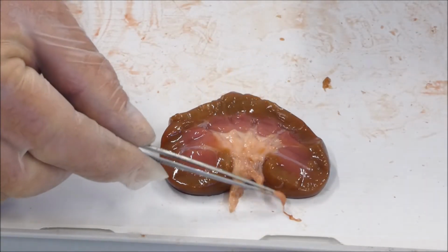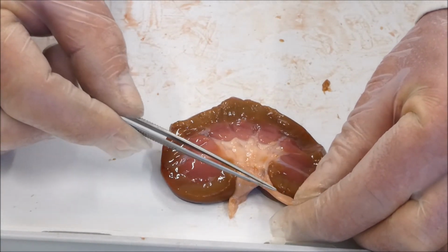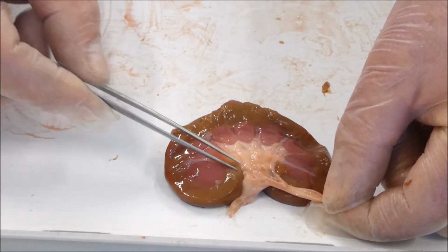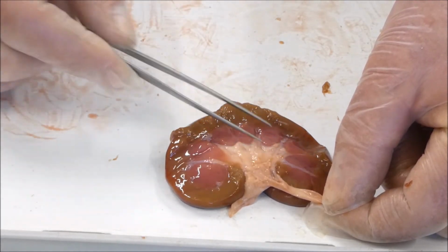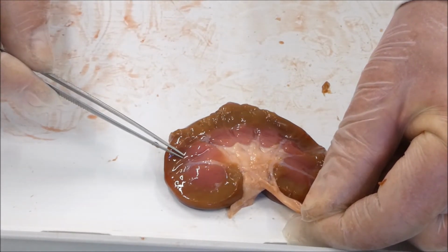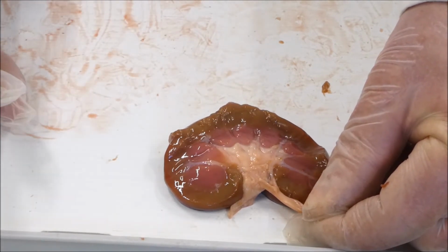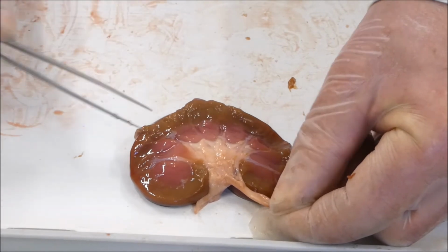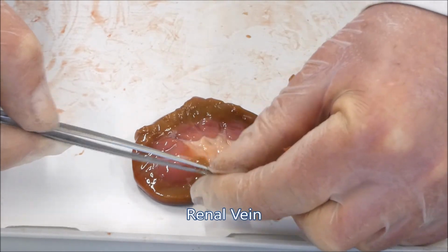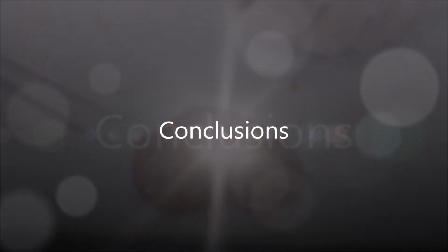Alright, so the other part of the kidney that you can't see as easily are the blood vessels of the kidney. Now the blood vessels of the kidney come in through the artery, so the thick artery here. They're not very obvious, but the artery branches out through all the renal medulla, through the renal pyramids here, and they take the blood to those nephrons on the outside of the kidney in that renal cortex where the blood's going to be filtered. And from that renal cortex, they then branch back through the renal capillaries back through to the renal vein, and then exit the body through the renal vein.